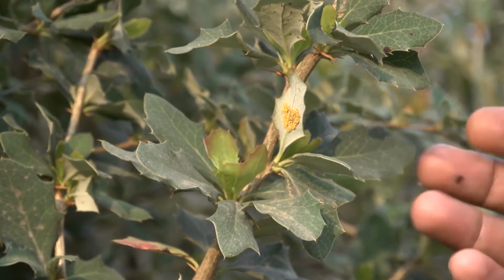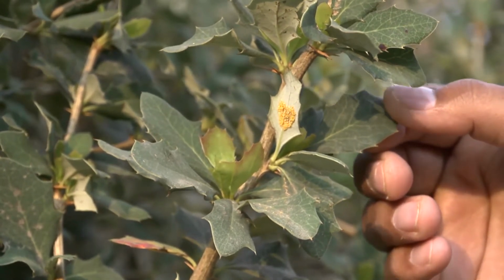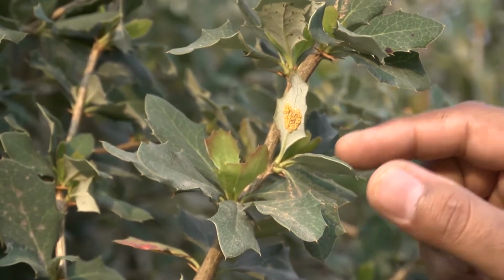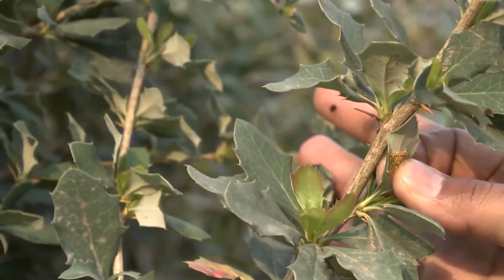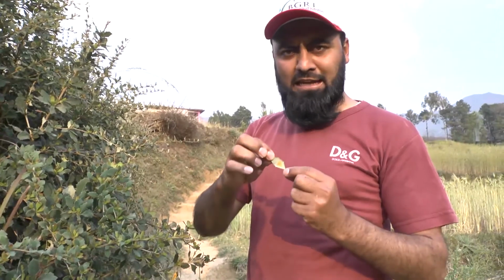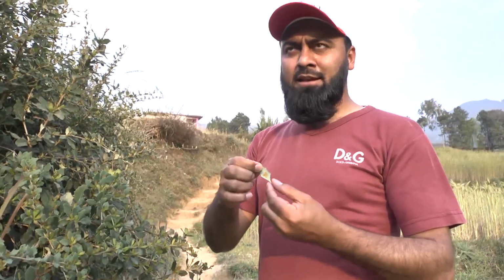Now, it can receive rust samples from different grasses, like Puccinia striiformis from Poa, from Dactylis and other grasses. So what we will be doing, we will collect the samples. We will collect these infected barberry leaves with aecia. Now, with these samples there are two possibilities.